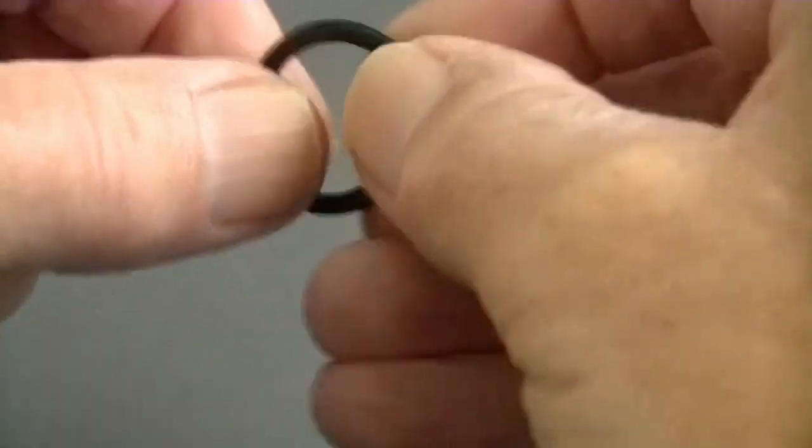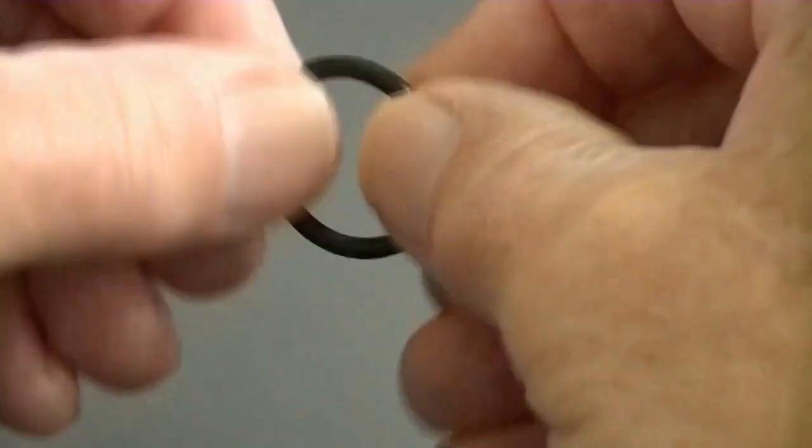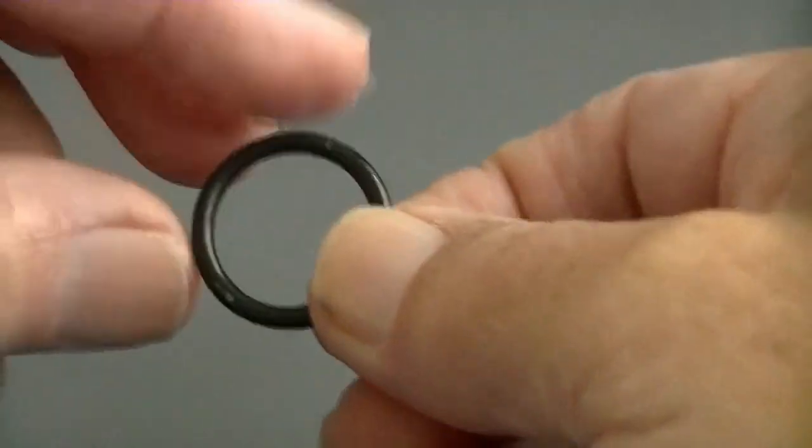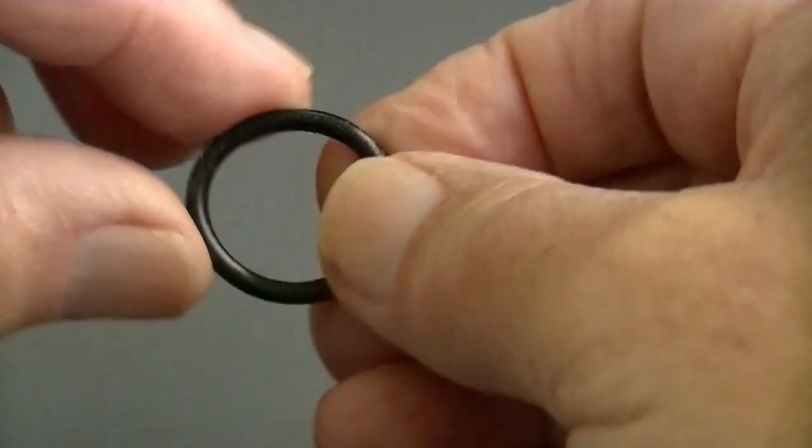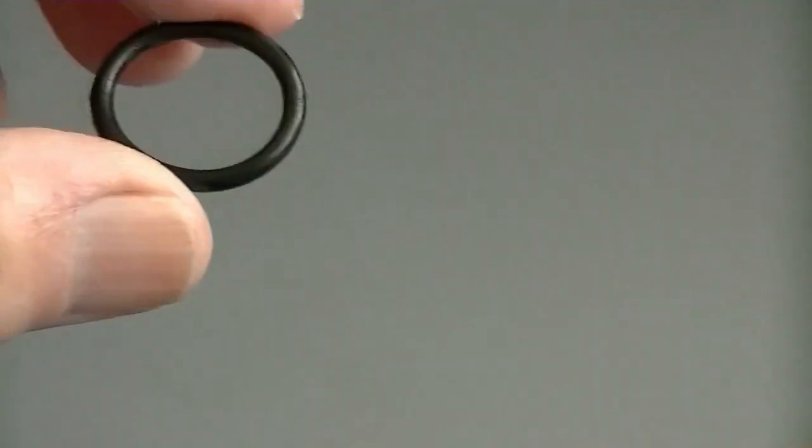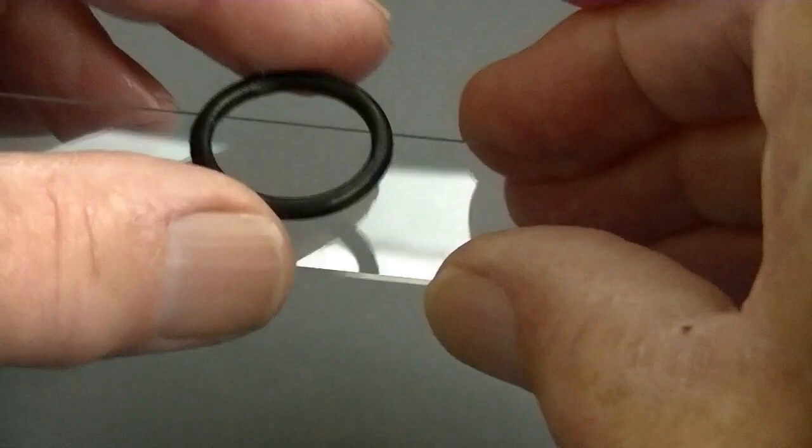I want to obtain a very thin film of Vaseline, the minimum amount possible, and remove any excess, and then place it on the slide.